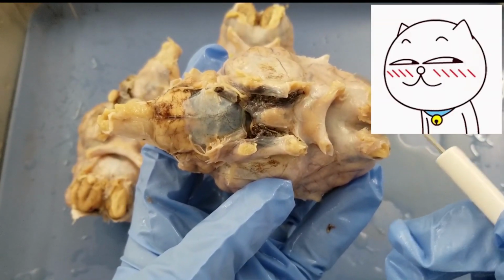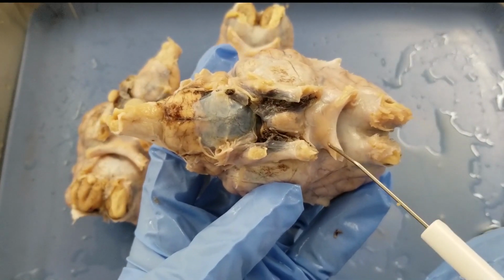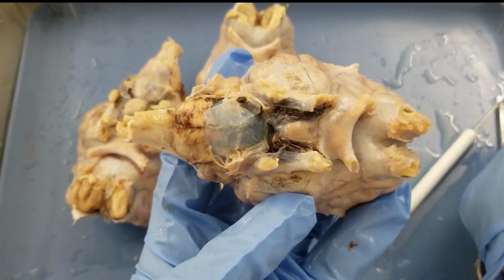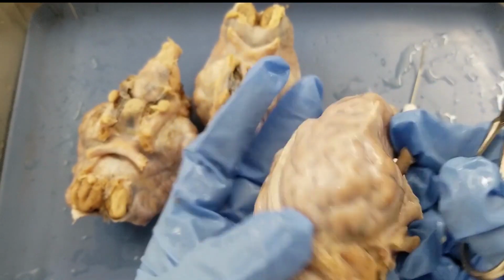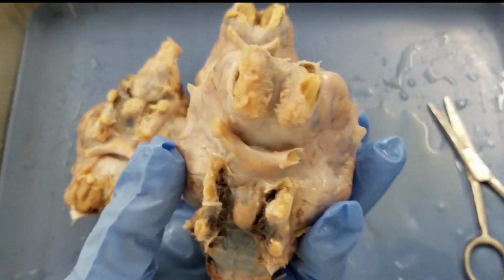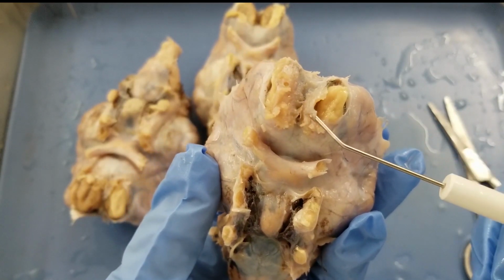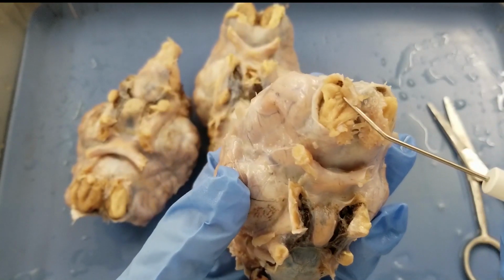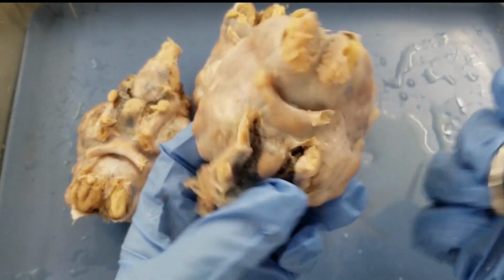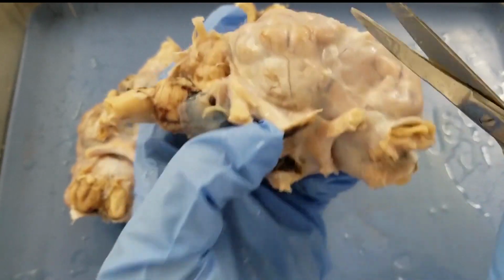Eventually, this nerve will go into the eyes, right? Sticking out from the brain. So this is the X shape. Chi means X, so that's the X-shaped chiasm. Now we're going to cut the meninges. And we'll have to be careful to preserve the olfactory bulb, which is here. Look, ooh, that looks like an egg yolk, yummy. And the other one is here, so we have to preserve them. Okay, so now I'm going to cut the meninges out.